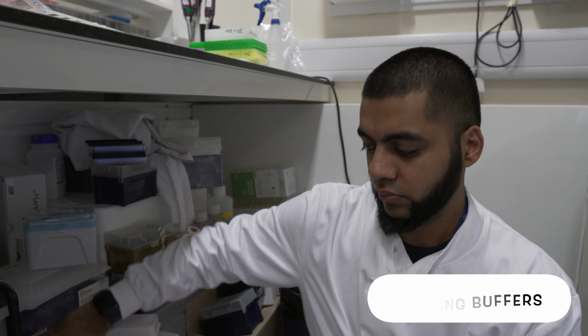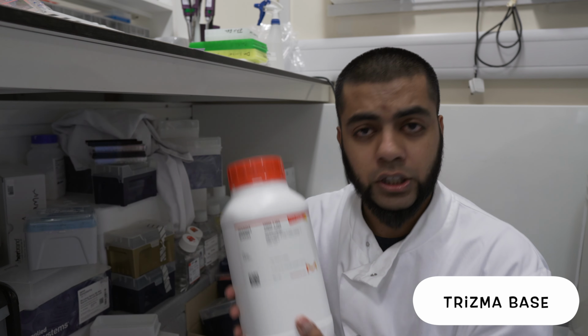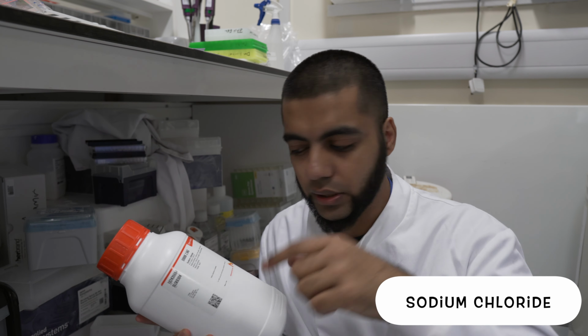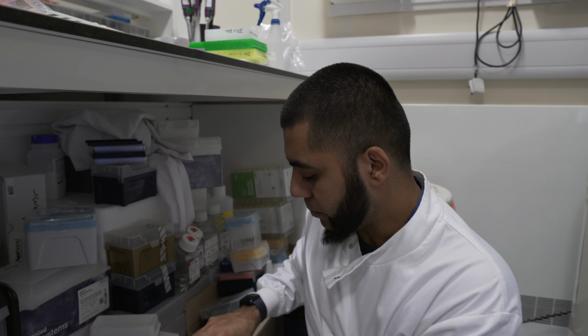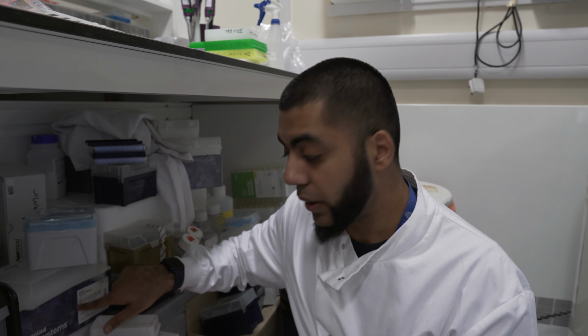Everybody knows about Trisma. Then we've got salt for your chips. Don't use this, alright? Don't quote me. It's the sodium chloride. But we know that sodium chloride is also salt, but don't use that for your chips. Just don't. And then we've got all sorts of tip boxes. We've got plates for... Don't know if you can see, let's bring it in closer.